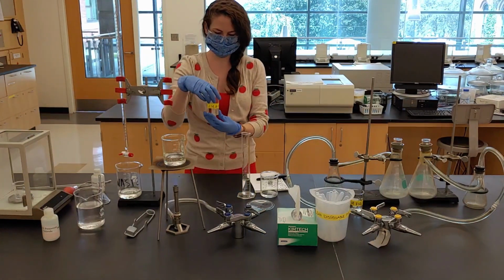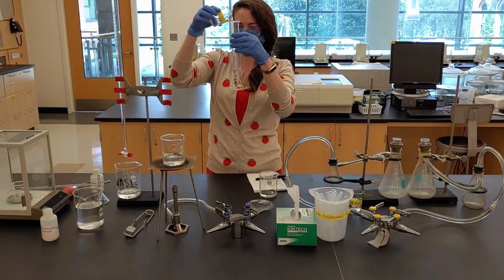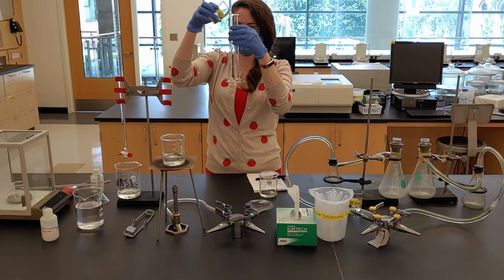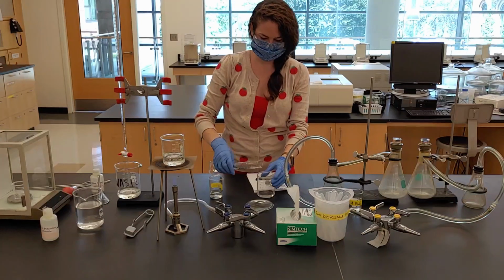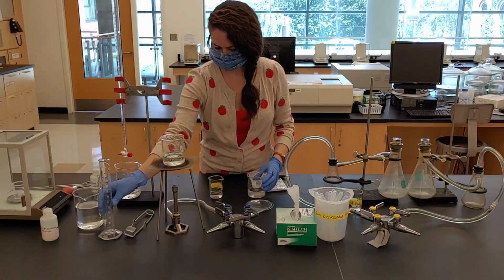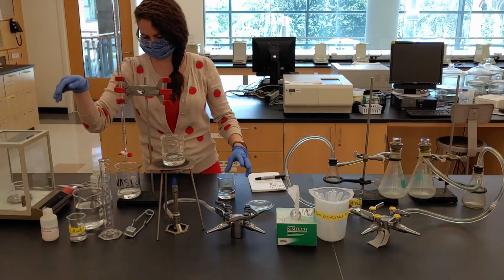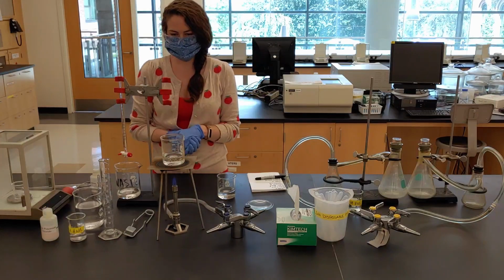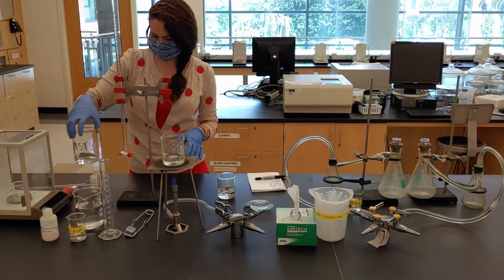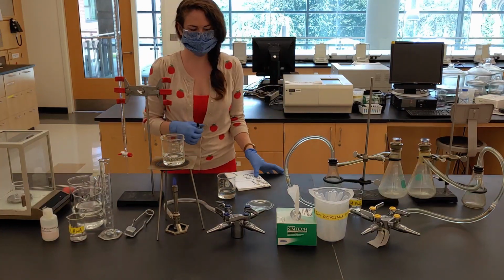Now that we have been provided additional nitric acid, we can finish measuring the remainder for the second trial. Record the initial volume on the burette.